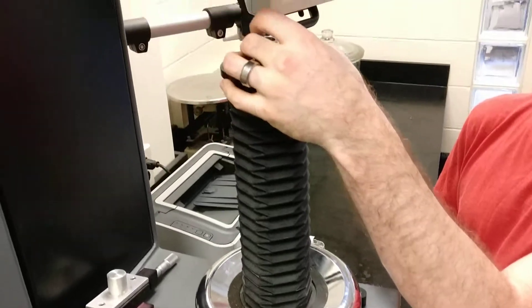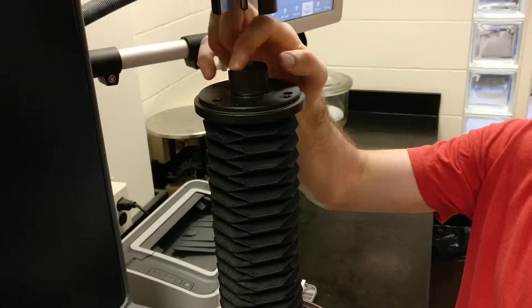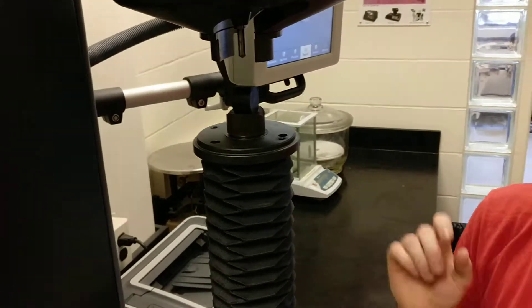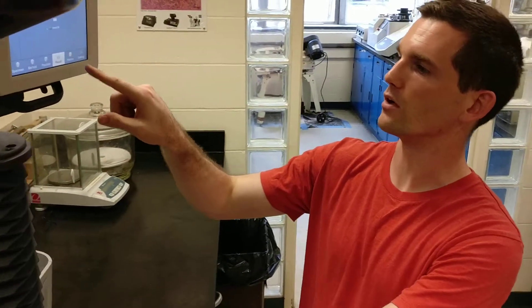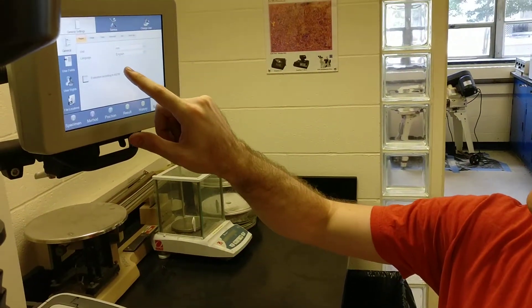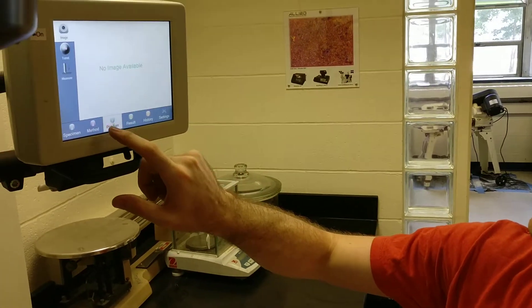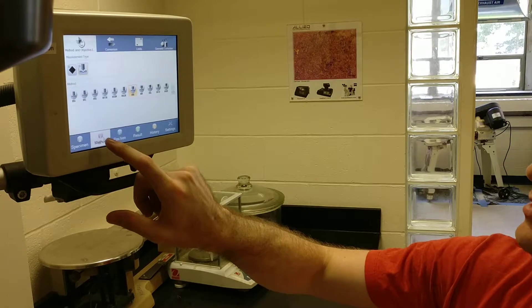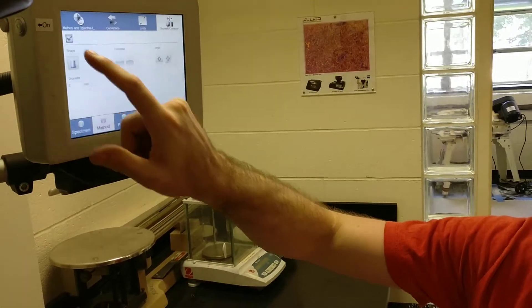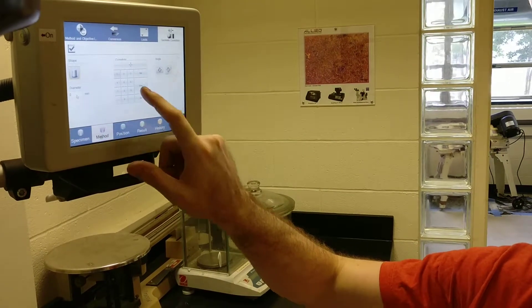You're going to put that ring on the inside, and then the indenter will fit in there so you can place a cylindrical object in it. If you measure the diameter of that cylinder, you can go into method, do geometric correction, choose the checkbox, and type in the diameter of your cylinder in millimeters.